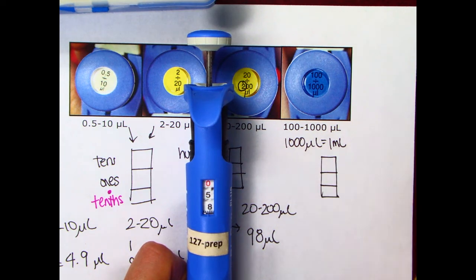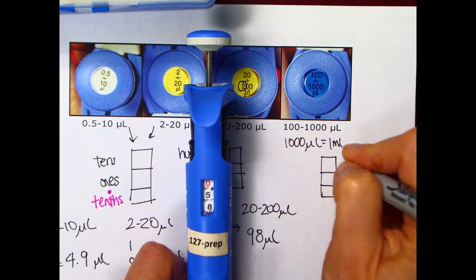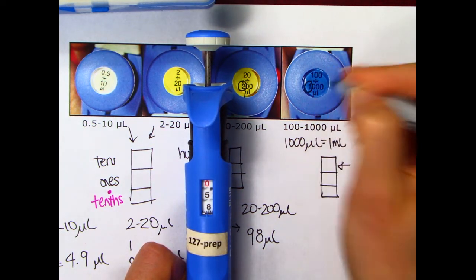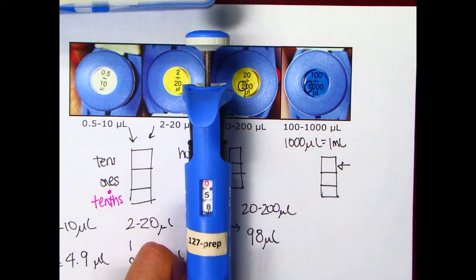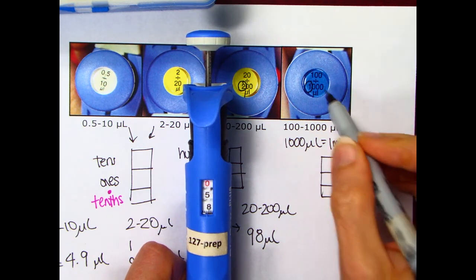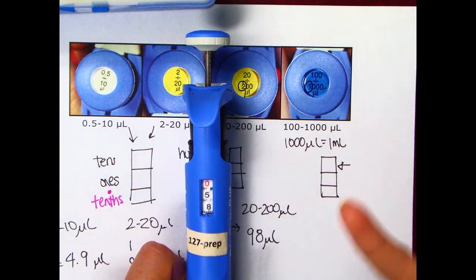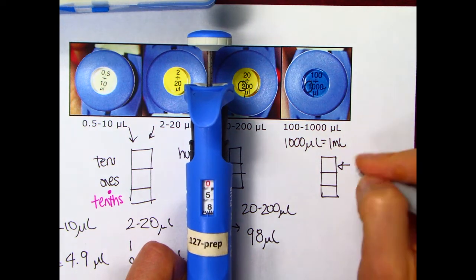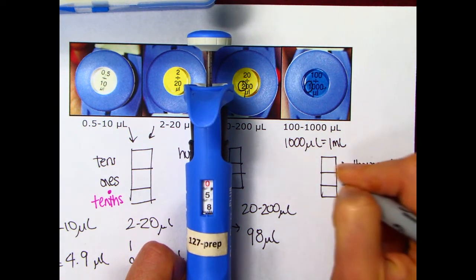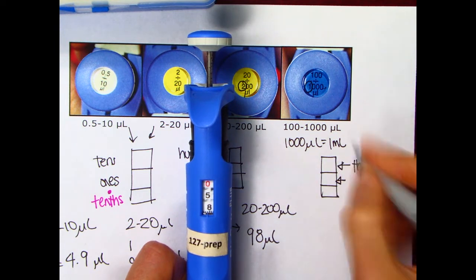Okay? So we look at our three boxes. Remember, the top box is always going to be the digit that is the largest digit of the biggest possible volume. So what place will this be right here? If the most this pipettor can measure is 1,000, then this place will be the thousands place. Then after that they just go down.